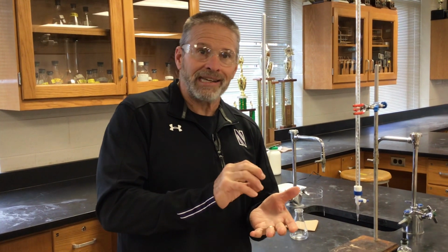You can actually see the flakes of NaOH get shiny because they're getting wet, absorbing moisture. It'd be especially bad on a really humid August day. There's a lot of water vapor in the air. So my point is, you can't get an accurate mass measurement. You'll say, I want to measure out exactly 40.00 grams of NaOH, and you dump that on and the balance reads 40.00, except some of that's water. You don't really have 40 grams of NaOH.